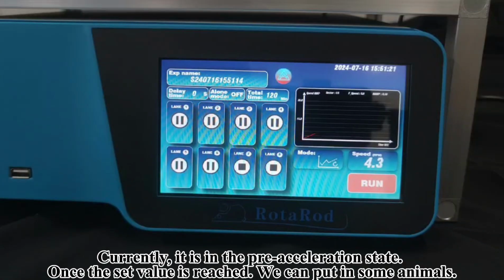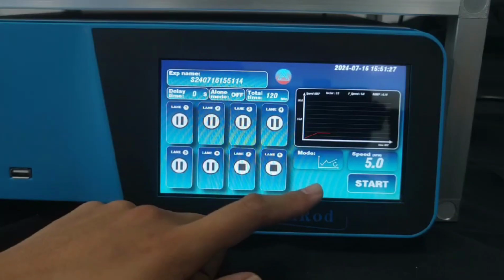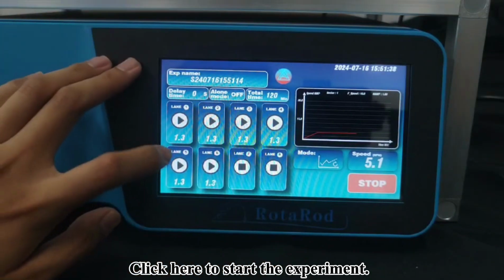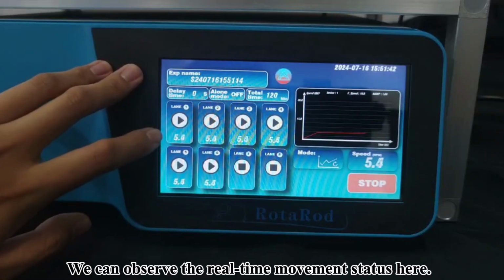Currently, it is in the pre-acceleration state. Once the set value is reached, we can put in some animals. Click here to start the experiment. We can observe the real-time movement status here.